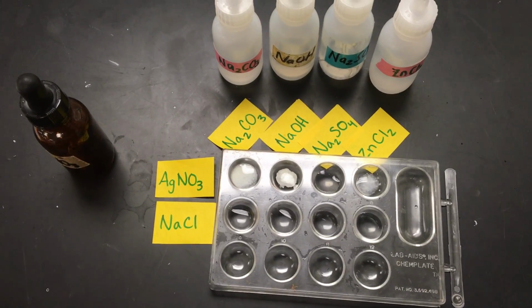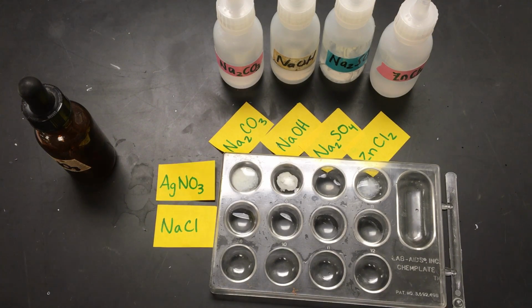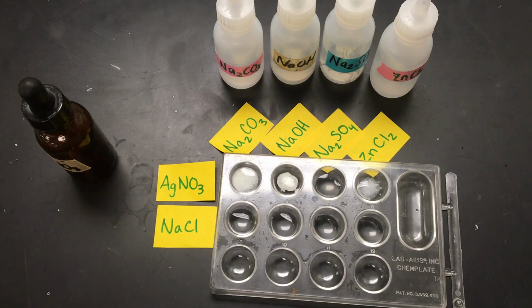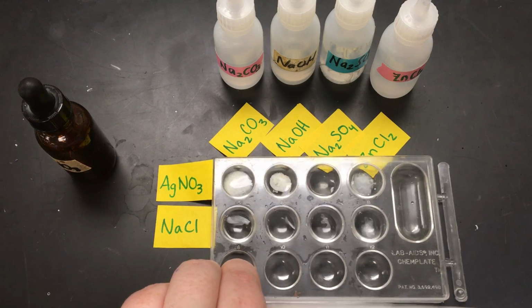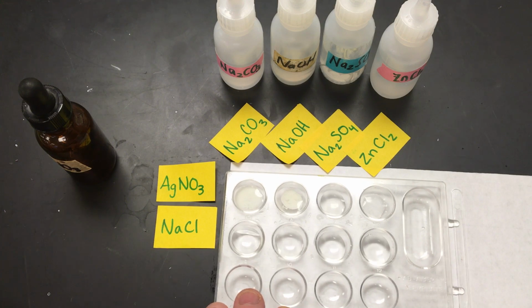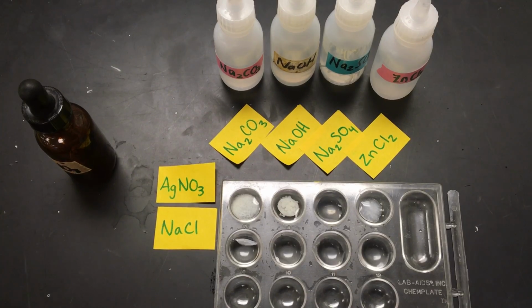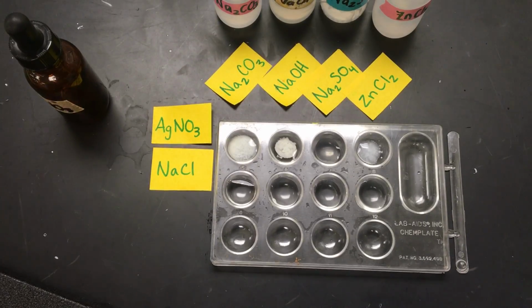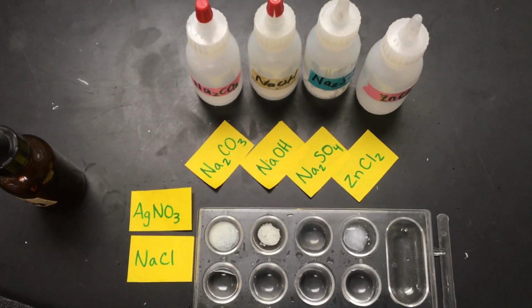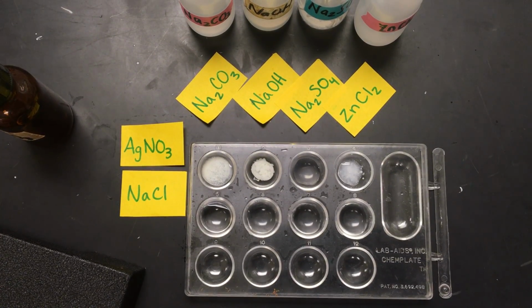Get you a little bit more of an overhead view here. And just in case you're worried you can't see anything because of the table being black, here's all that same stuff on a white piece of paper, but because most of the stuff we're seeing be formed is white, then I think that the contrast of the black lab table gets us the best view.